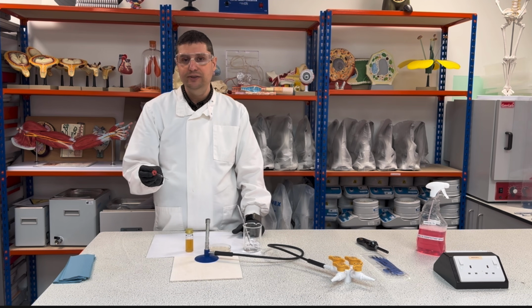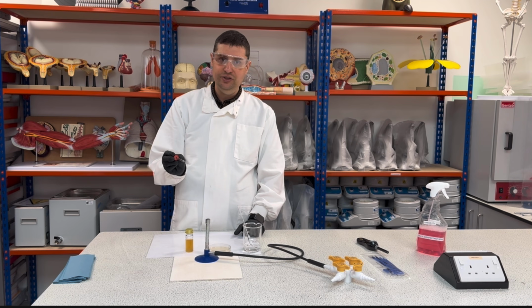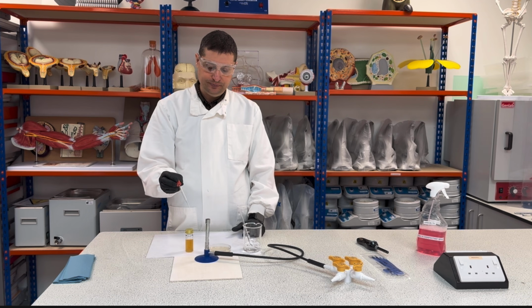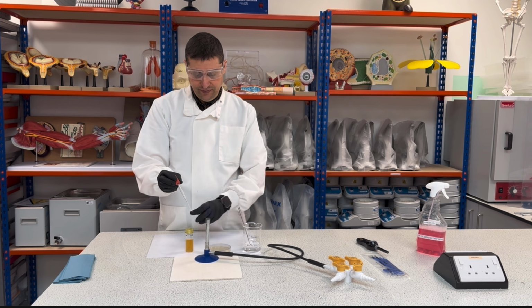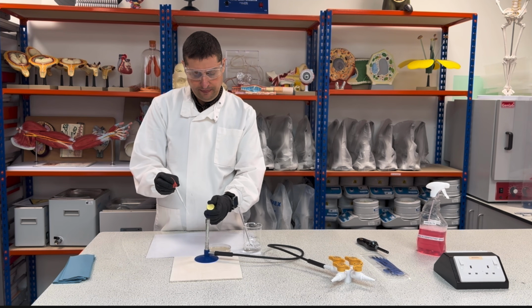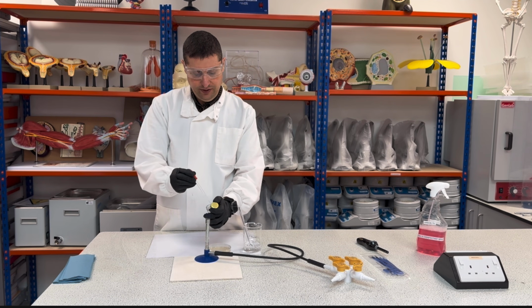I don't need to heat too much, okay? I just want to disinfect this. So as soon as it's finished, I can keep this close enough here to cool down, and then I will open my bottle, close here, and I will collect my bacteria.